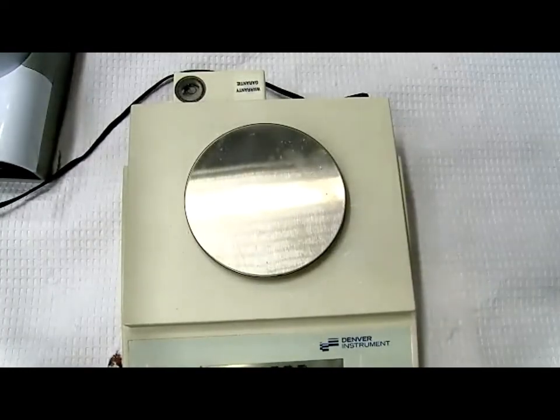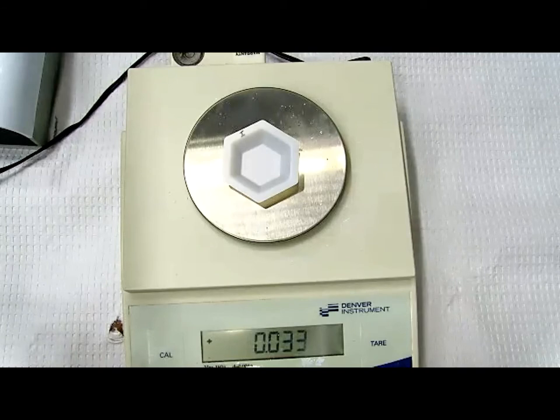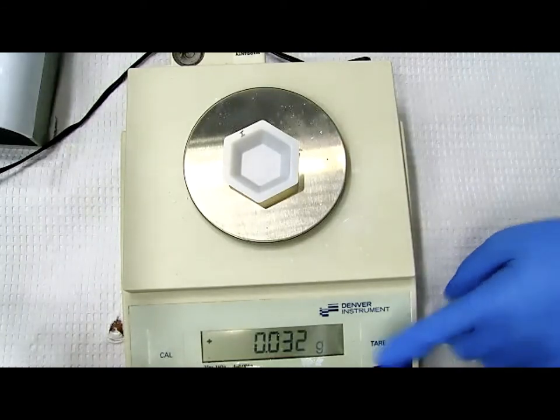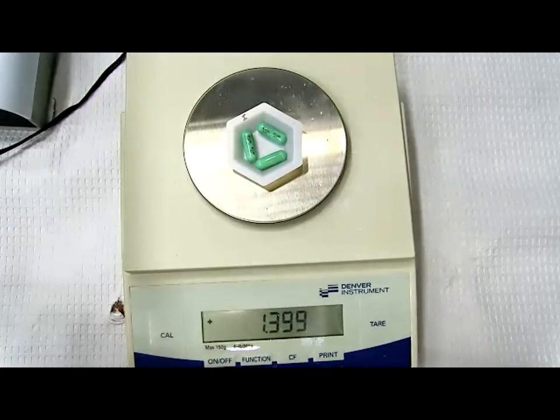All right, so let's go ahead and measure the weight of 3 capsules. I have a weigh boat here labeled I for indomethacin. I do not want the weight of the weigh boat, so let's clear that. And let's place 3 capsules on top to find out the weight. Just to be consistent, let's write everything in milligrams. The scale reads in grams, so I will read it off as milligrams.